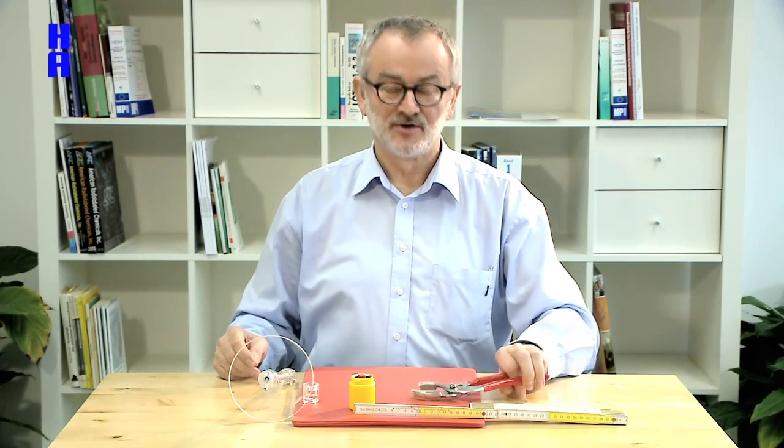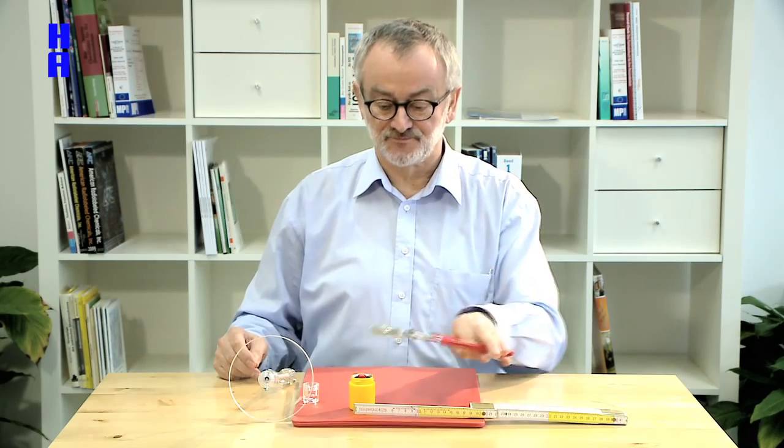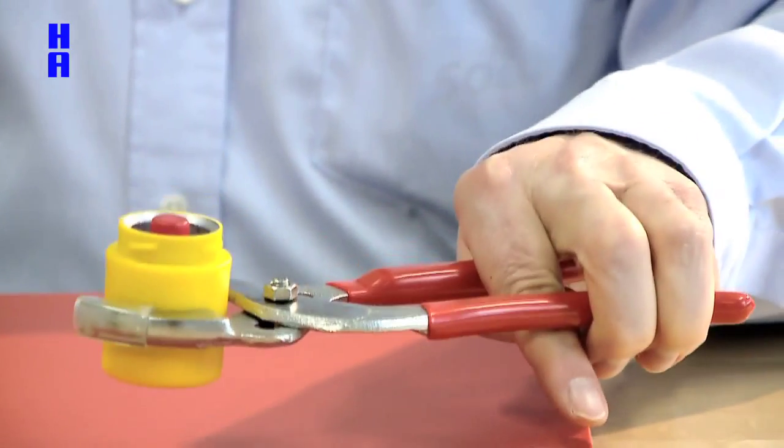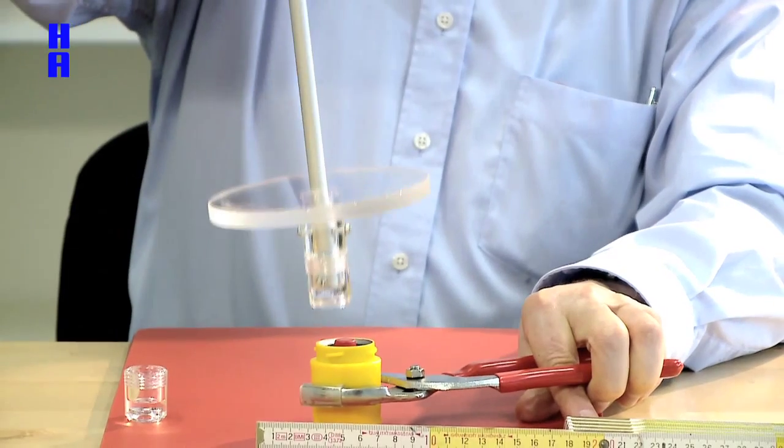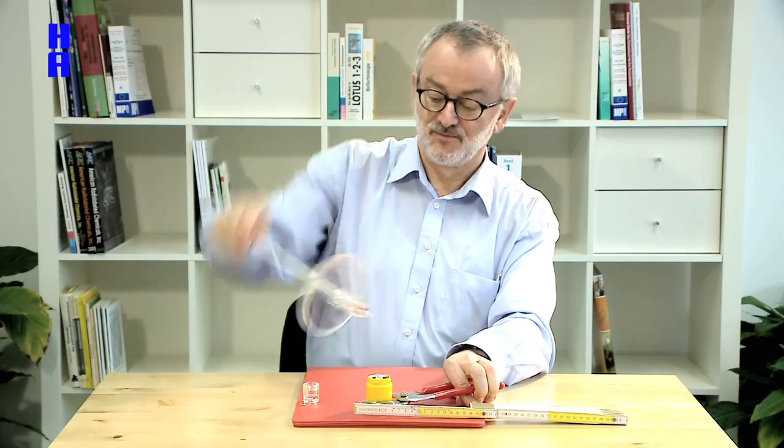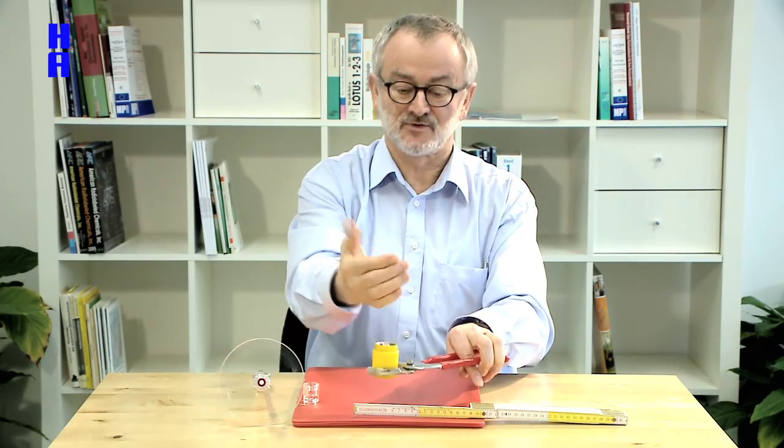you may want to use tools like these. Just put on top here, have a safe and secure grip, take a tool like this to open the inner Eppendorf tube, turn it around, put it away and start pipetting.